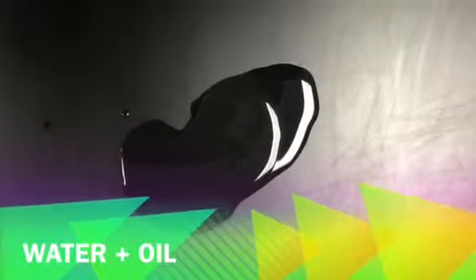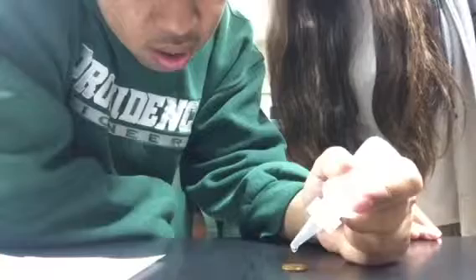written in my notebook. Okay, so the type of intermolecular bond the oil has is dispersion, because dispersion is the only intermolecular force that can have a non-polar bond. Dispersion has the weakest force, and as you can see over here, that's the last drop, and we had 14 drops of oil, and obviously the drop was pretty weak.